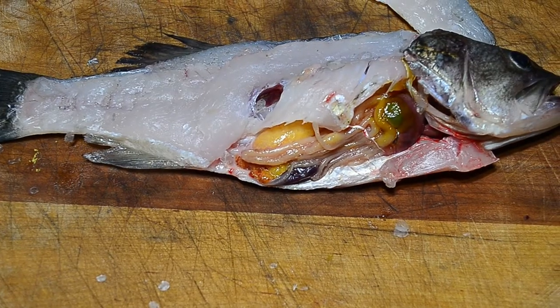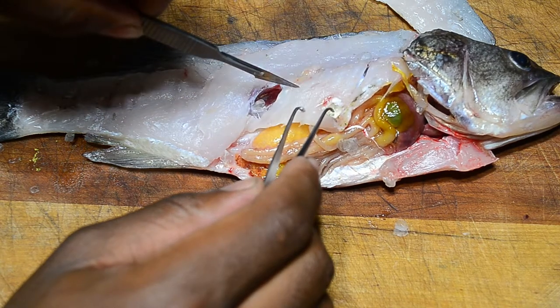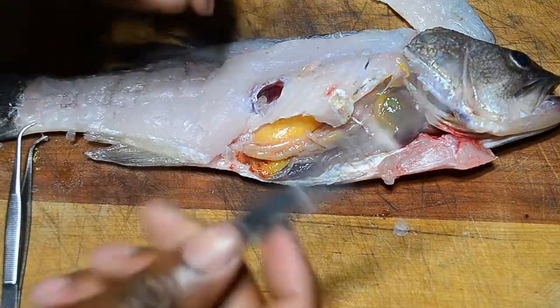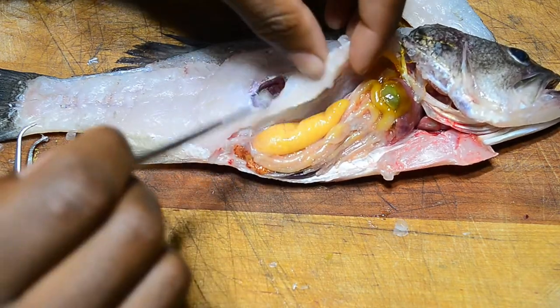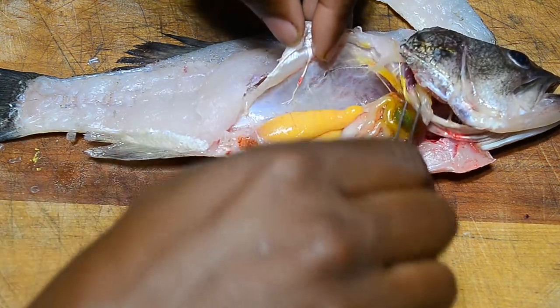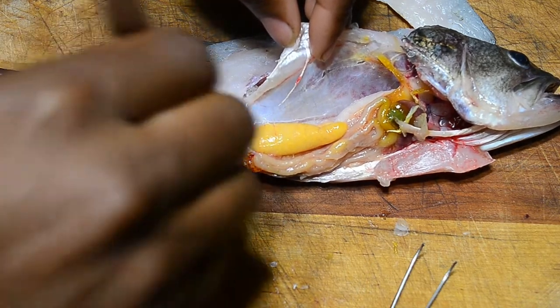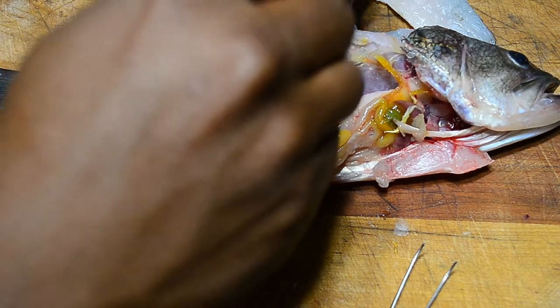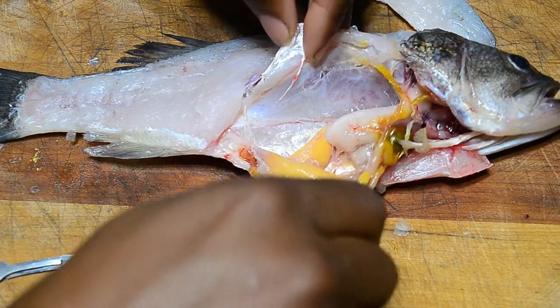Let's look at the organs. This one was a female — you can see the ribs here. This is the swim bladder right here and it's pretty big. You can tell it's a female by the eggs she still has — this is bass roe, bass eggs.